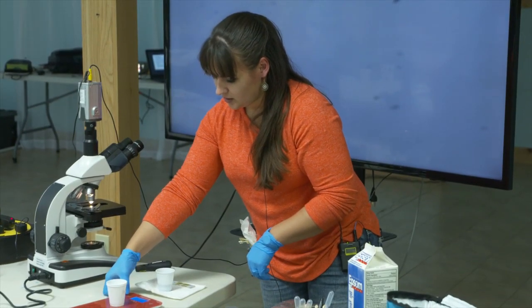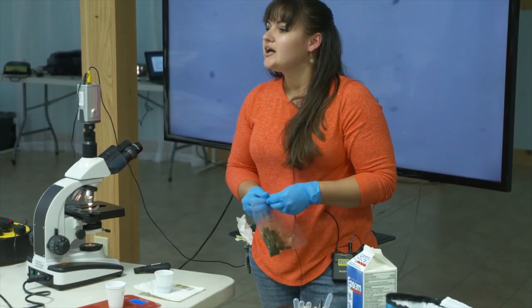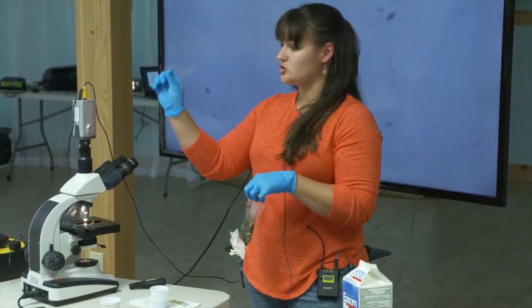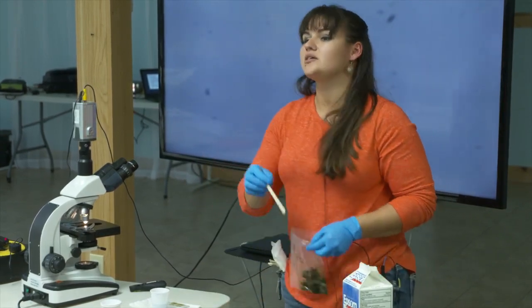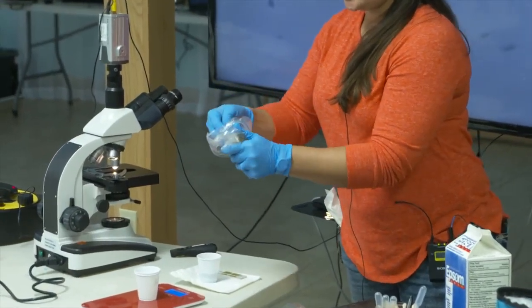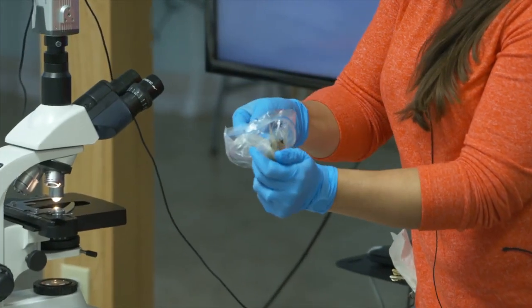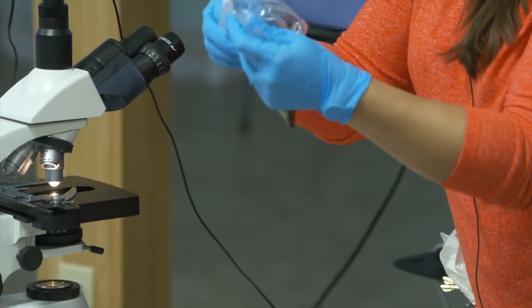In rule of thumb — and you'll understand why I'm trying not to laugh — two grams is typically about the tip of your thumb from your joint to the end. A lot of vets don't even weigh it; they just add what they think is necessary. We're going to take our measuring tool and go through it. Sometimes it's easier to use a plastic spoon, but craft sticks are a lot cheaper.